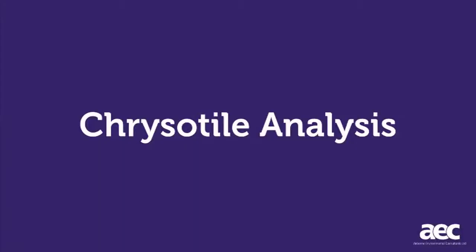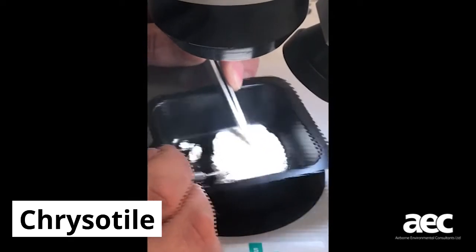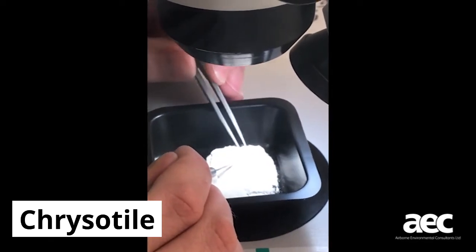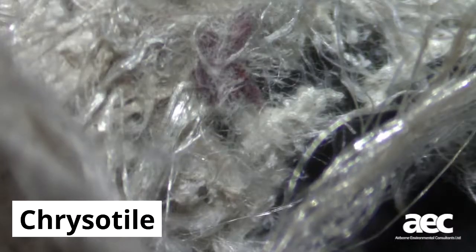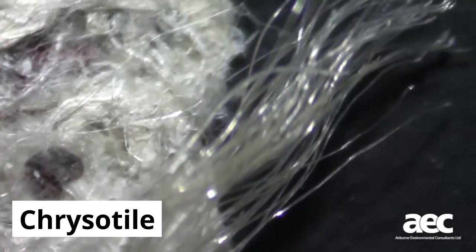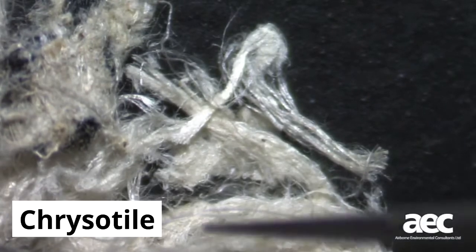Also within insulating board, you can often identify chrysotile, or white asbestos, mixed in with the amosite. So the analyst goes back to work, manipulating the sample in search of these fibres. Chrysotile is a serpentine form of asbestos, which results in a much more flexible and curly-looking fibre than amosite. The analyst finds suspect chrysotile fibres and separates them from the sample once more.